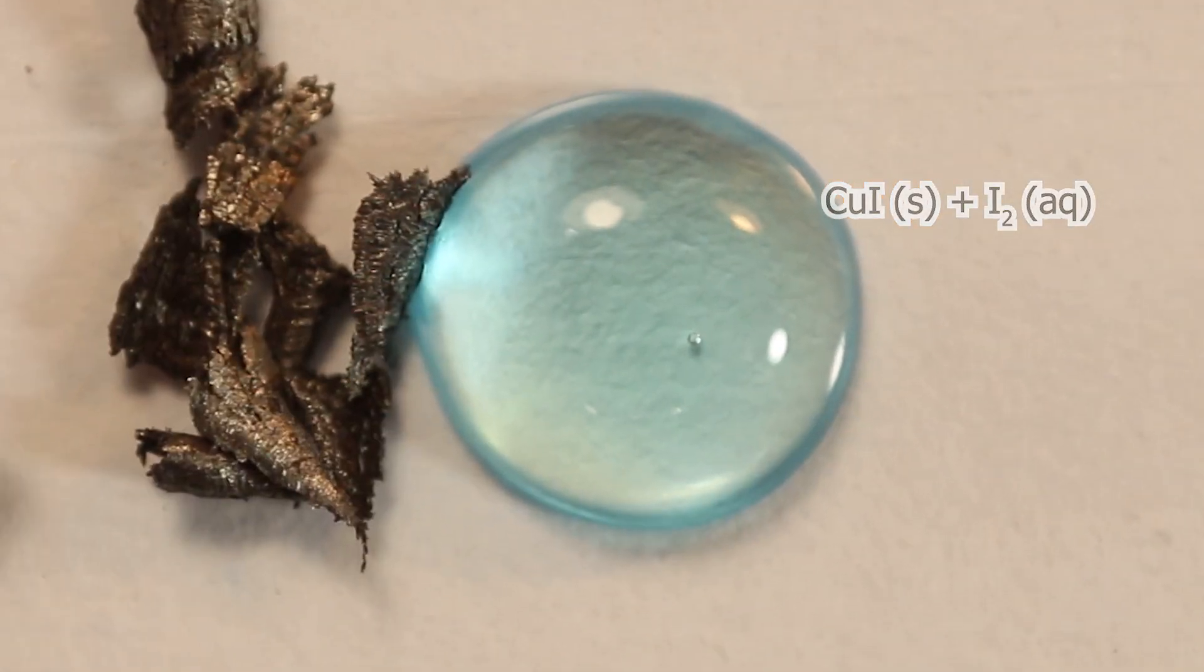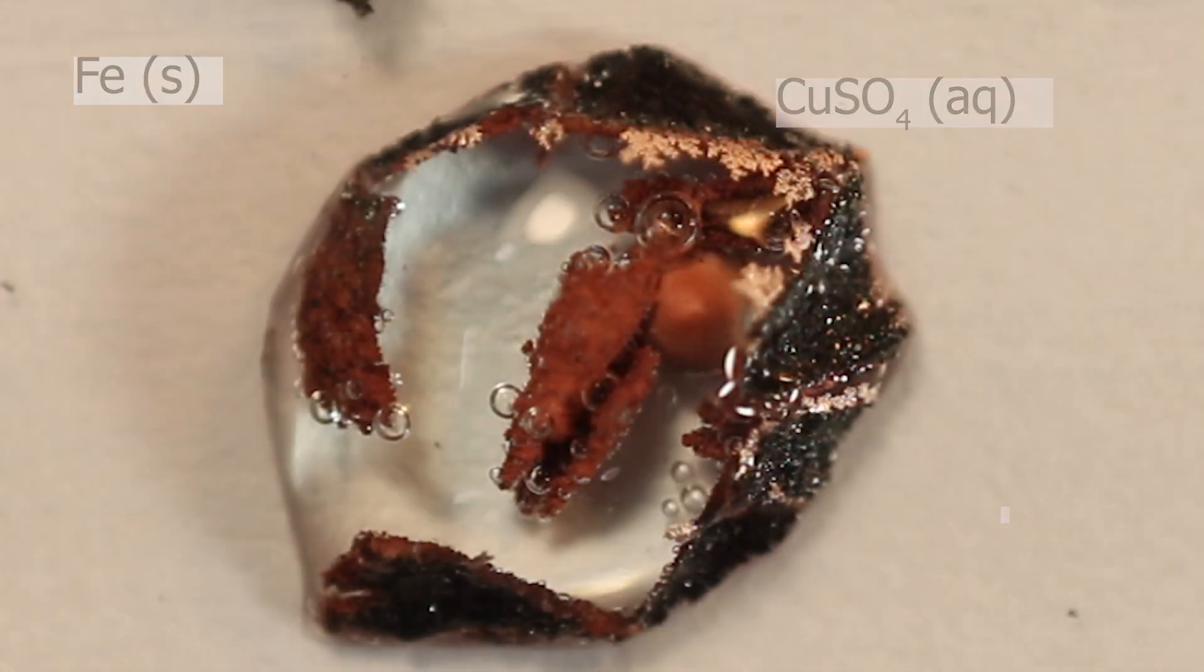And the last one, addition of iron filings. Formation of metallic copper.